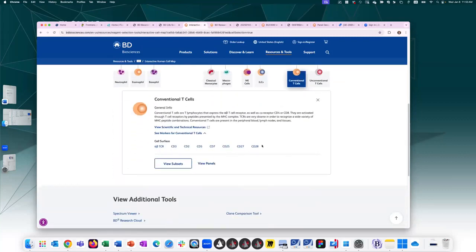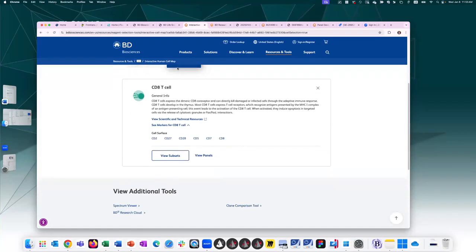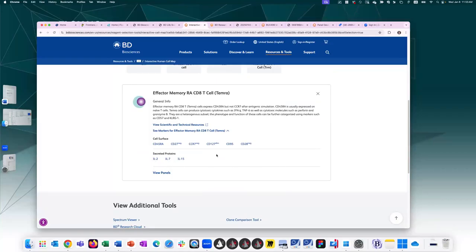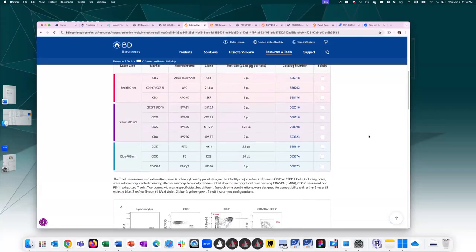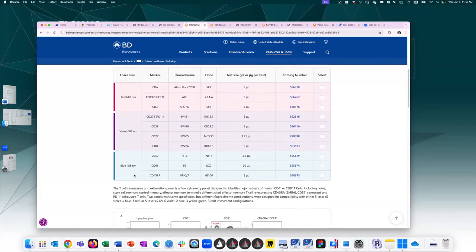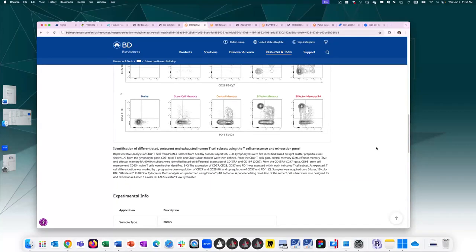It will show me what cell surface markers are commonly used to define them. I can click on any one of these for more information, or I can expand to see more subsets. So it shows me that T cells come in CD4 or CD8. If I'm interested in CD8, I can click on that. I can expand it even more for additional cell subsets. In this case, I can click on effector memory CD8s. It shows me which additional cell surface markers are relevant for this population. And I can click on view panels that shows me a list of panels. All of these are in BDRC as well. If I click on this first one, it will show me what the panel consists of. But what I really like is that it shows you the gating strategy that comes along with that panel. So even if you don't plan on using this exact panel, having the gating hierarchy and the examples of good staining examples of those different markers is very helpful when you're doing that literature search to fill out step 2.